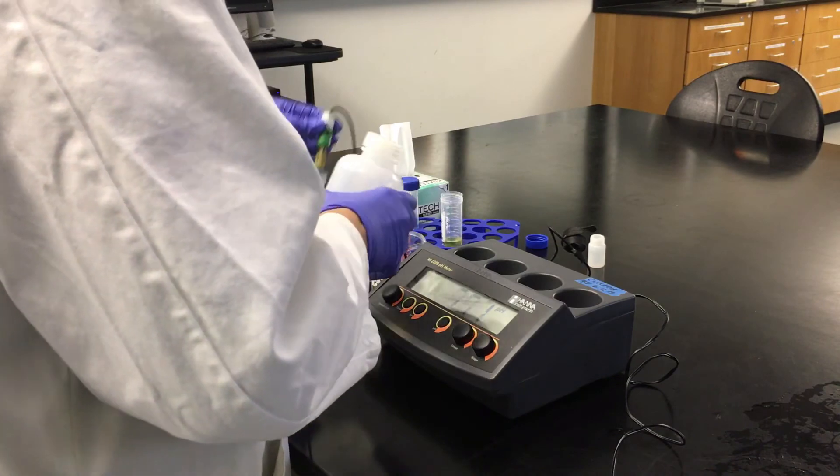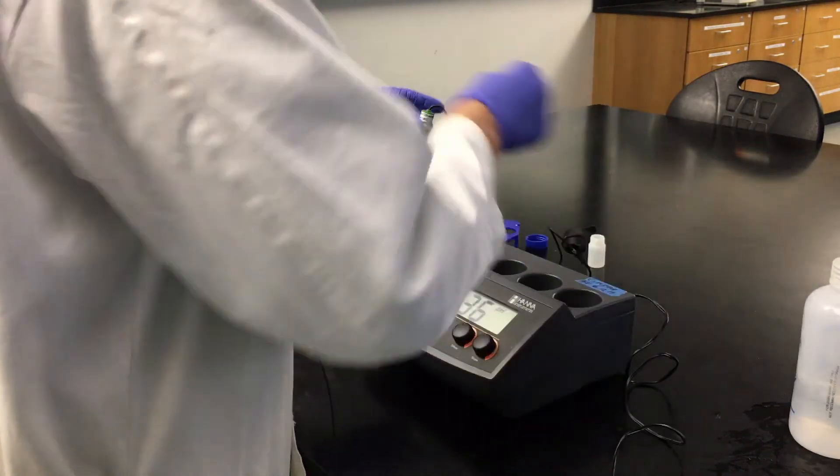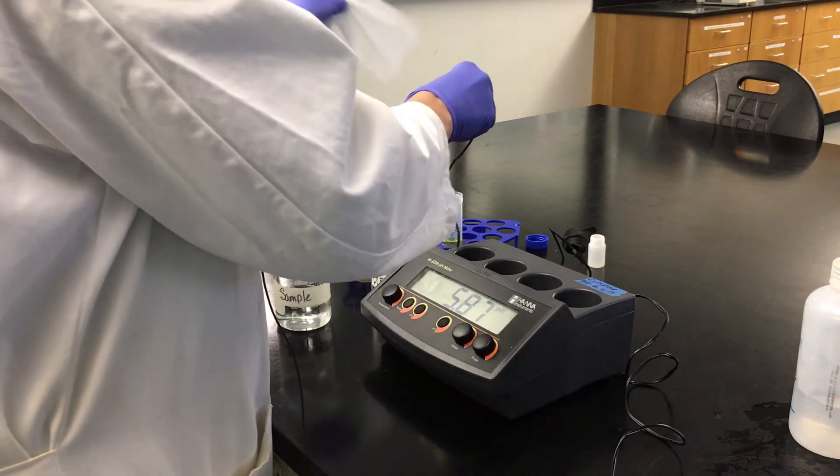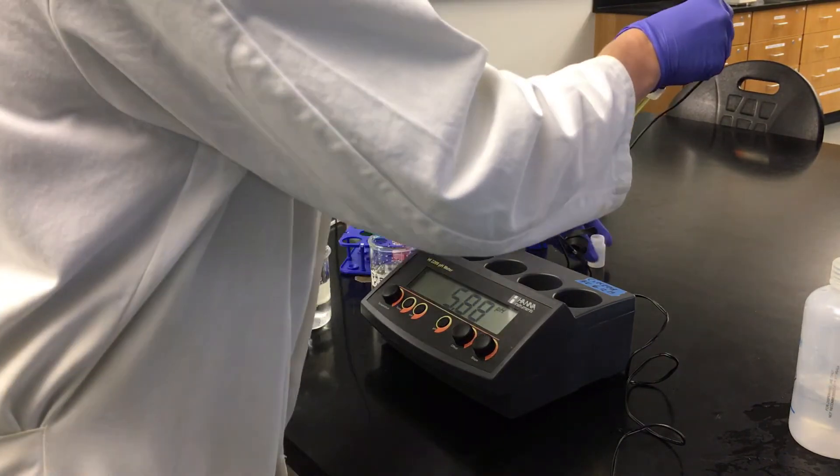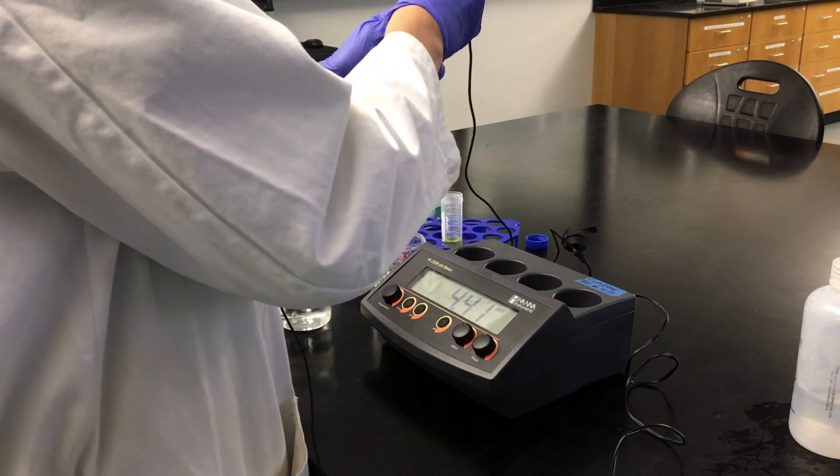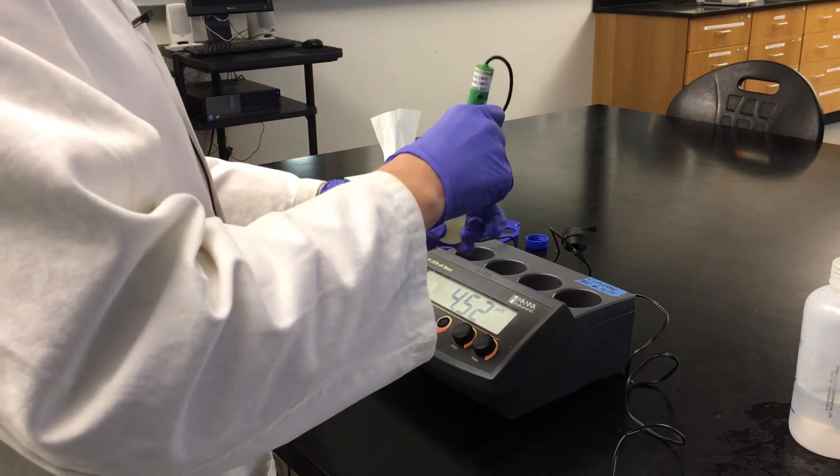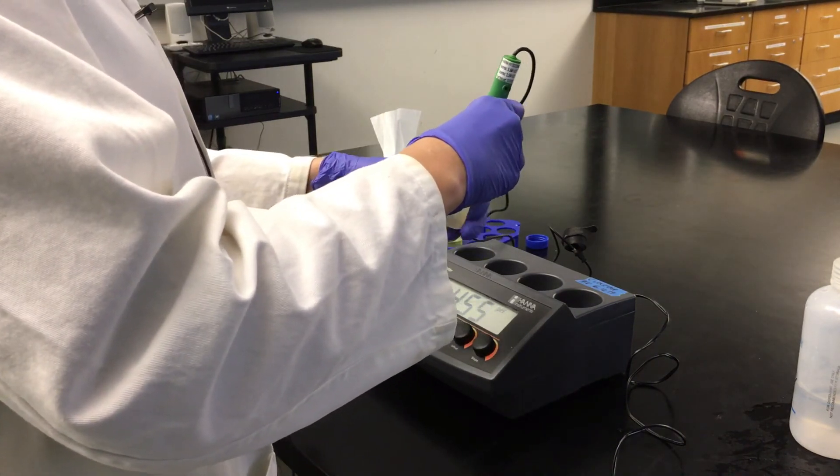So once you're done taking a reading of your sample, and we're done taking all of our samples, we're going to carefully return the probe to its storage solution.